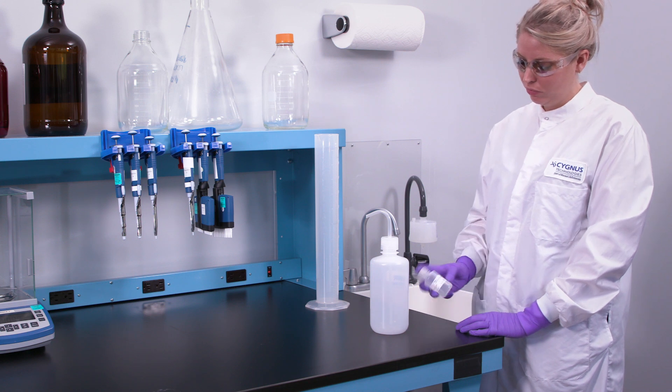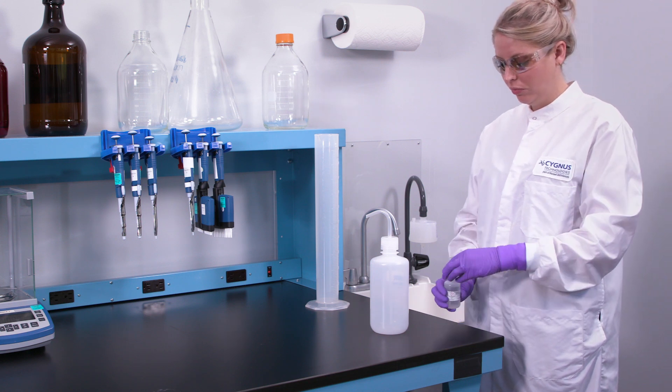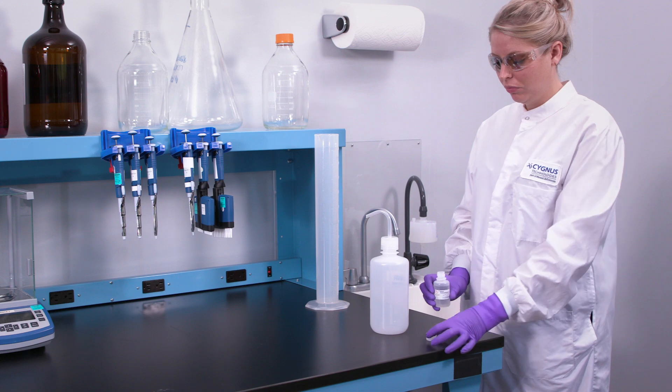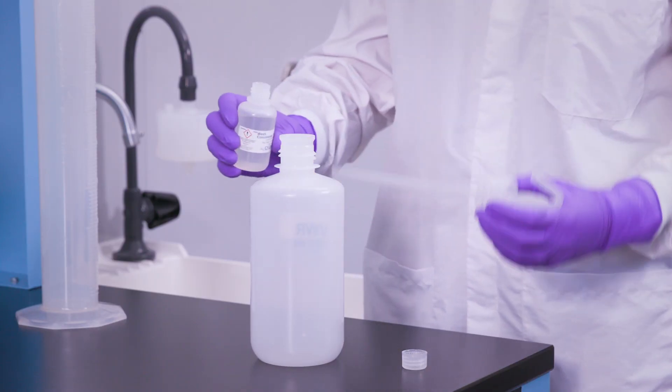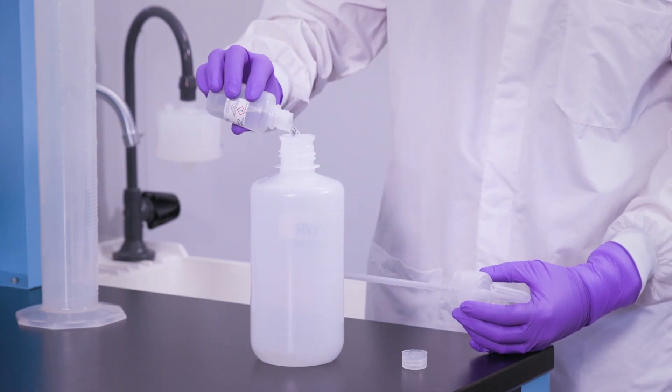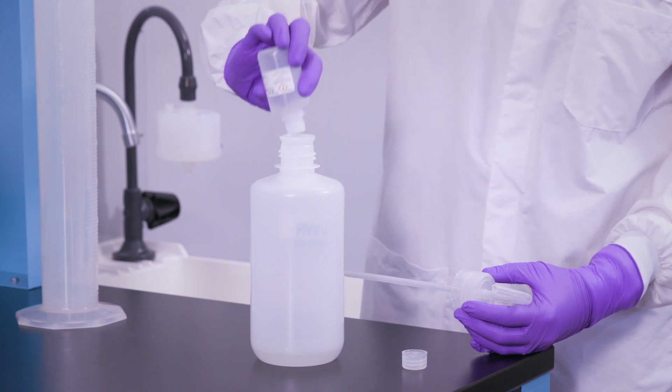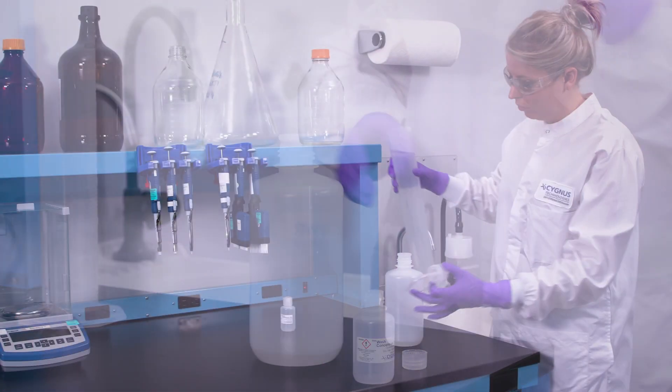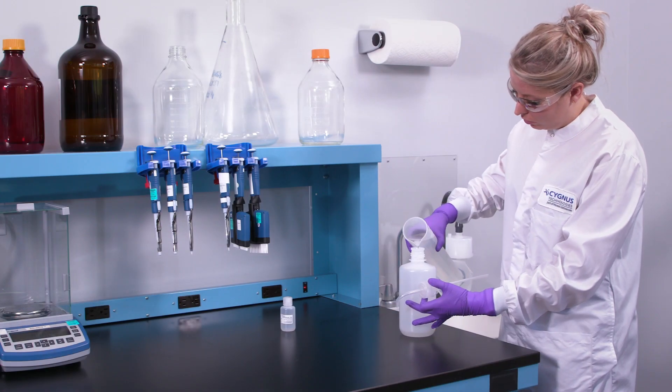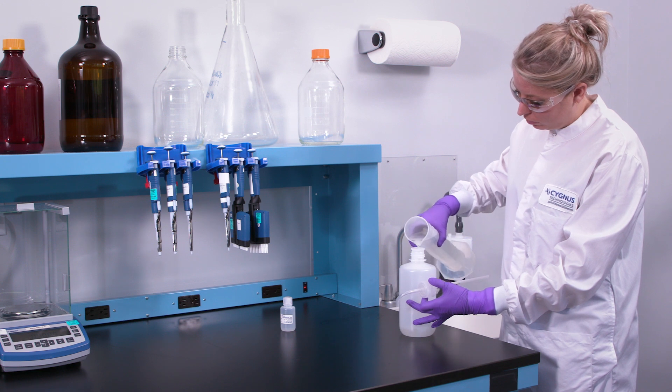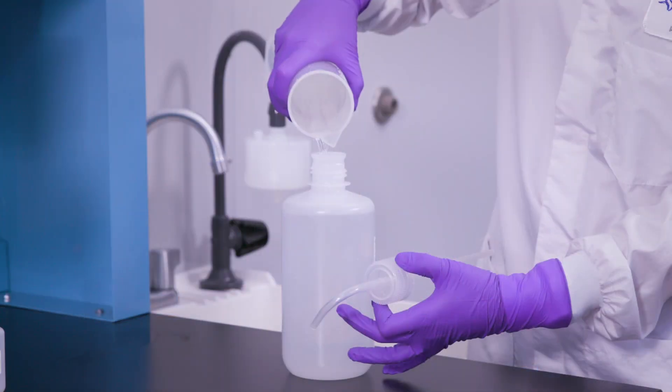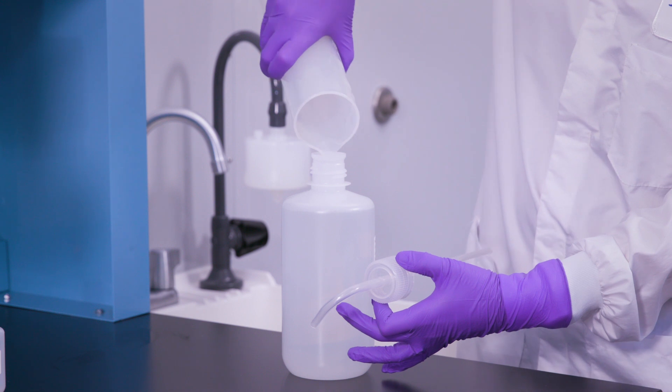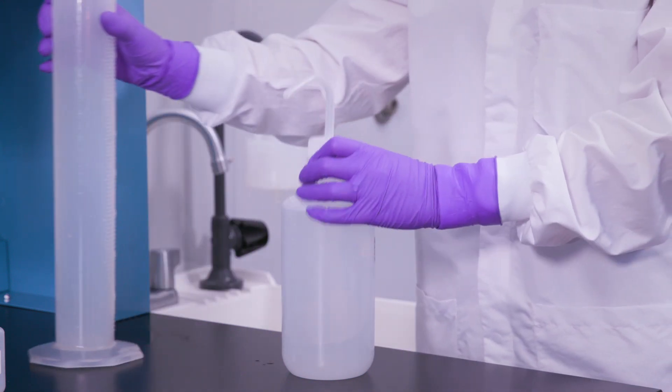Before getting started, prepare the wash solution in advance of testing to minimize delays. To do this, empty the contents of the wash concentrate provided in your kit into the 1-liter wash bottle, then fill it with distilled water.